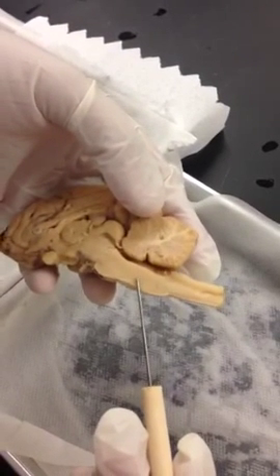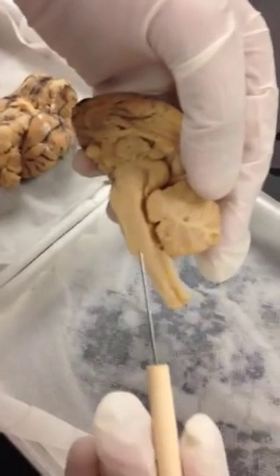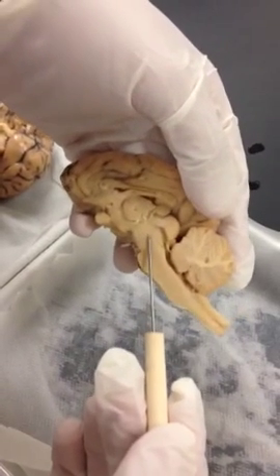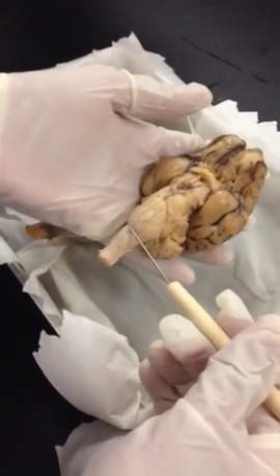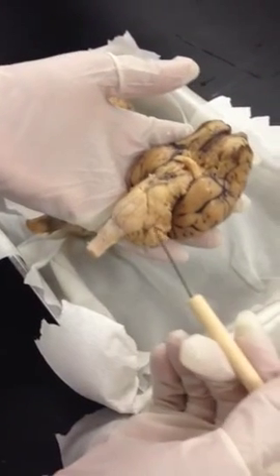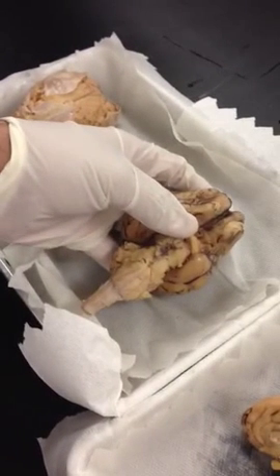The first bump is your medulla oblongata coming from the inferior end of the stem of the brain. The next bump is your pons, and above that is your cerebral peduncle. So in this view, you can see the medulla oblongata, the pons, that's your cerebral peduncle. The spinal cord is all the way towards the end.